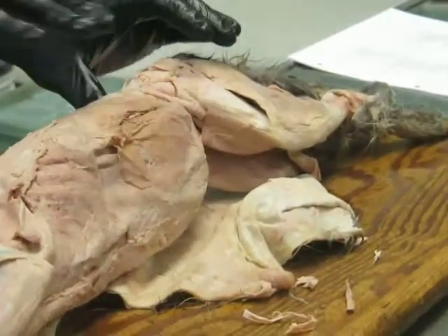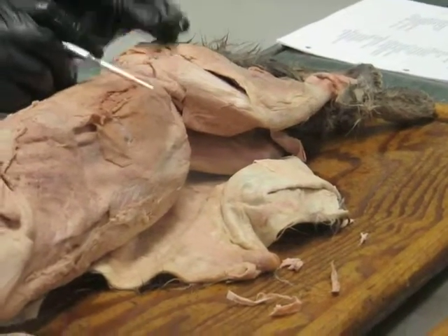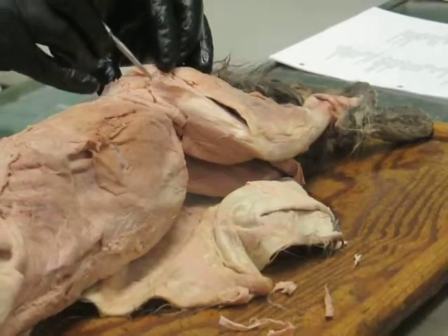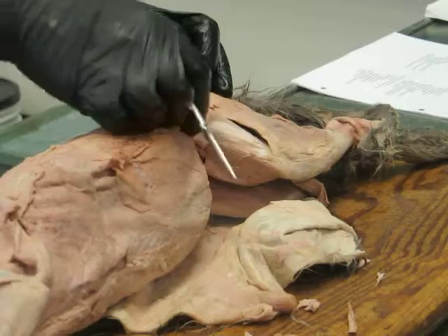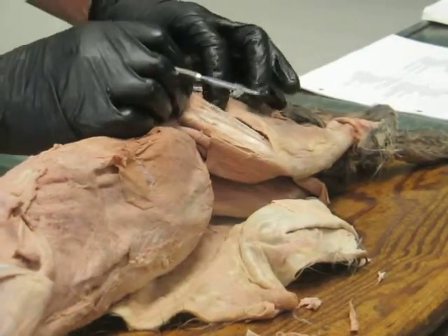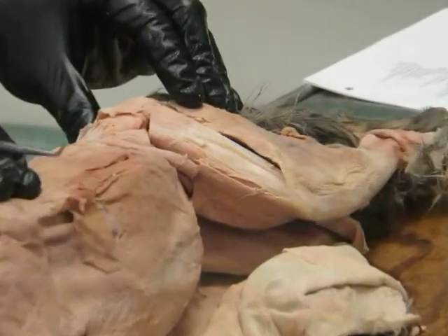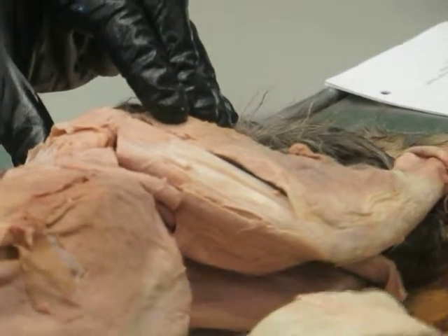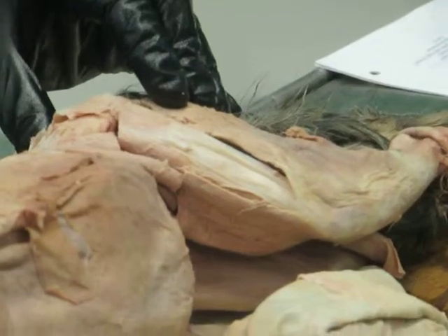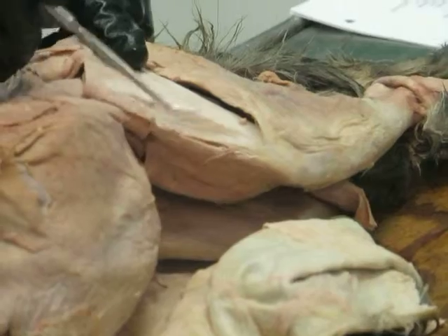So let's start with the cat, since I've got him here. And I know most of you guys started kind of in this area here and started with this muscle. This is tensor fascia latae. Okay, and this fascia that runs down is the fascia lata, which is literally just the broad fascia of the thigh. And what is a fascia anyways? Not tendon. It's basically just a sheet of connective tissue. Okay. So I just wanted to make sure I actually defined that for you. So this is the fascia lata.